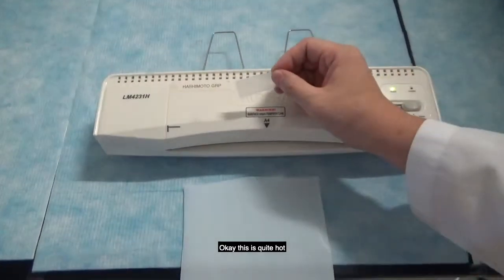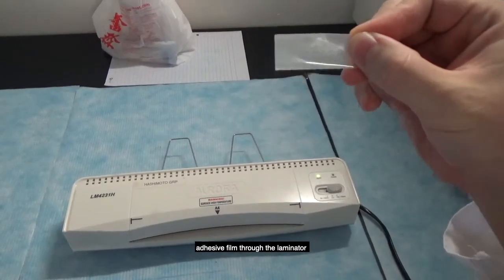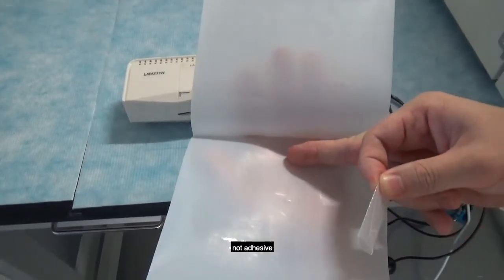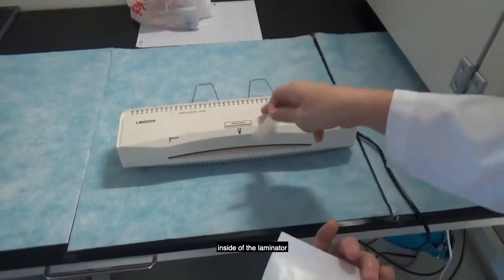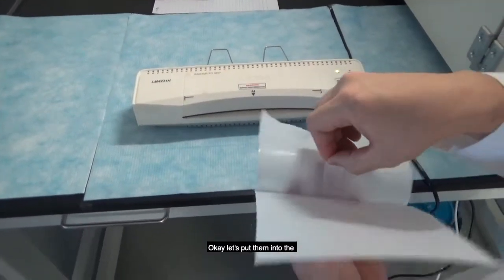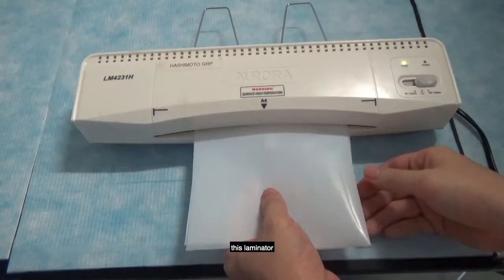Okay, this is quite hot, so be careful. So now you are going to place this adhesive film through the laminator. To do so, please make sure to use this protective film. This is a Teflon film, which is not adhesive. Without using this Teflon film, this adhesive film is going to get stuck inside the laminator, and this is going to break the laminator. So place this between the Teflon film, and then let it go through the laminator.